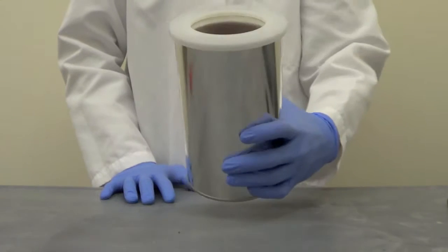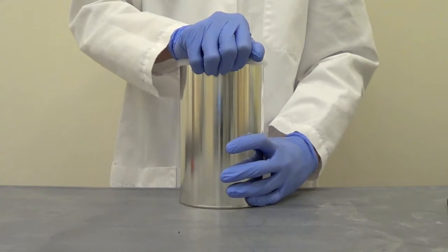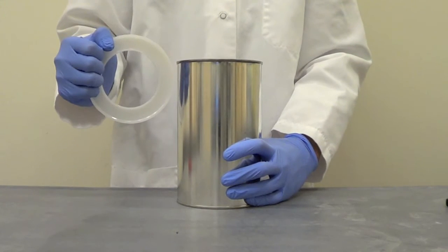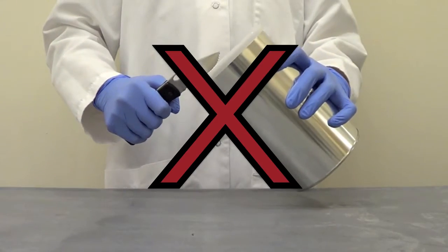Here's how to open it. Use your hand to grasp the outer edge of the patented locking ring. Pull upwards using light to moderate force. Do not cut the locking ring.